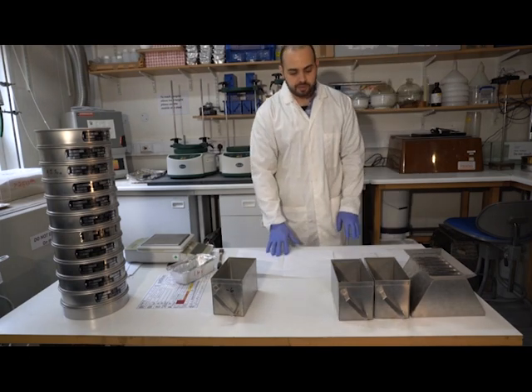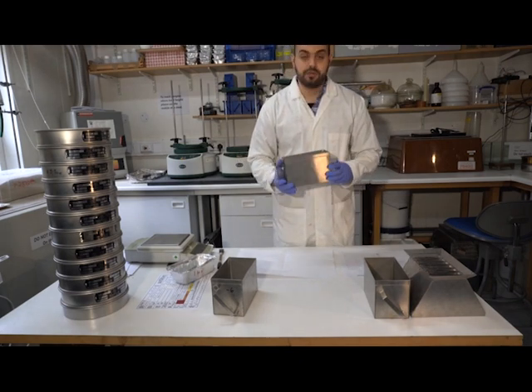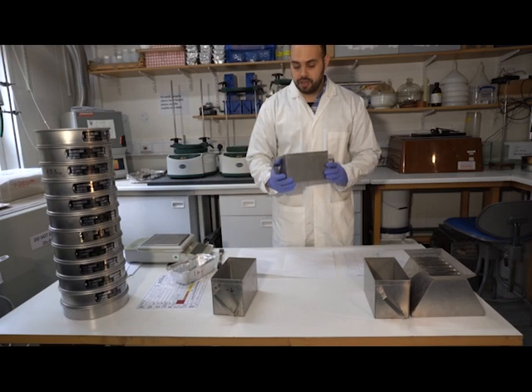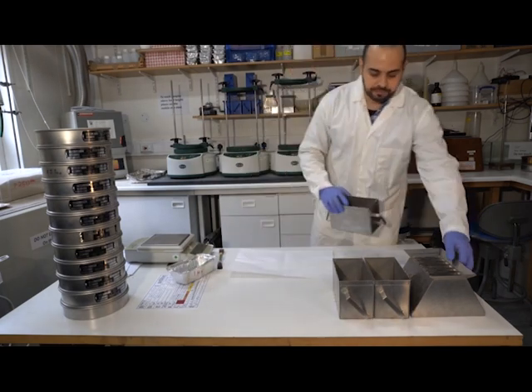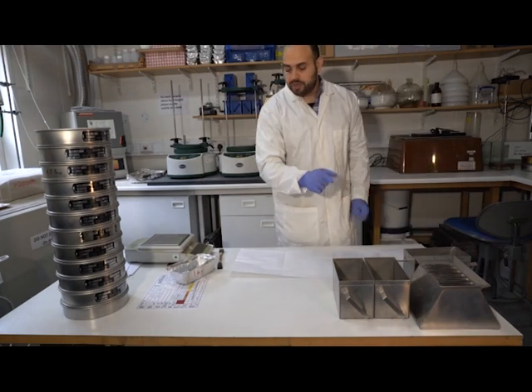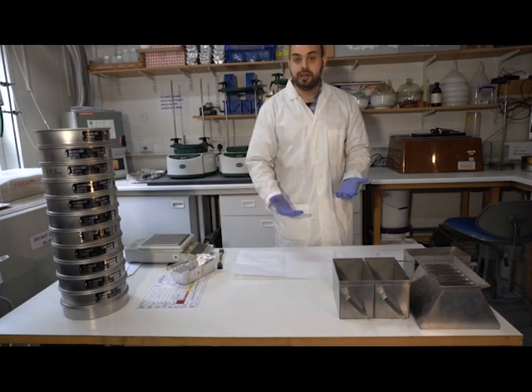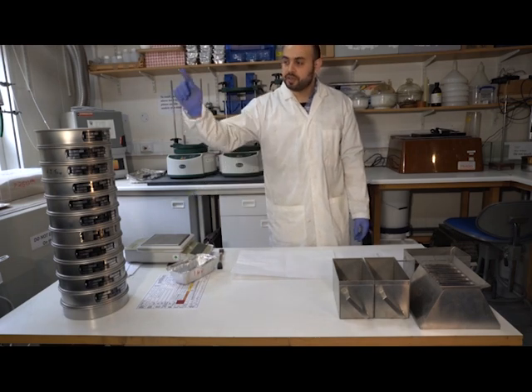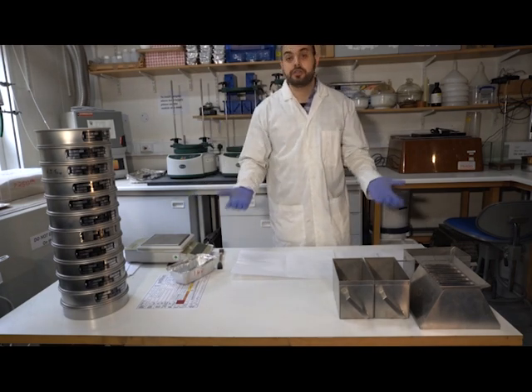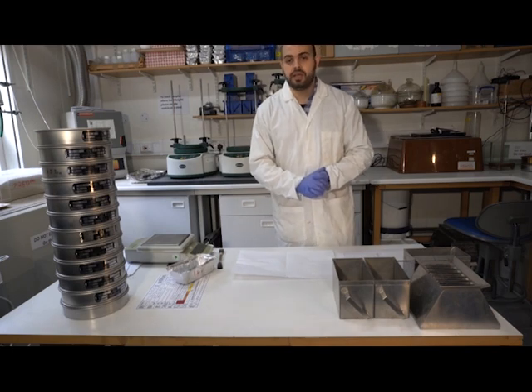So this is really a bimodal sediment. I can see that very clearly because there is a lot of sand in here, but there's also a considerable fraction of gravel as well. So before we start sieving our first sample, we really need to measure the weight of sediment here at the beginning, and at the end we're going to compare that with the cumulative sum of the sediment masses retained in every class and assess if we've lost or maybe gained any in the process. So it gives us some quantitative measurement of any error in sieving.